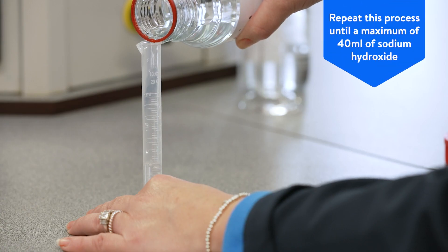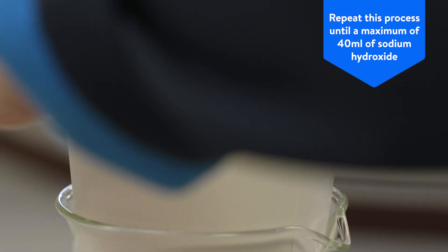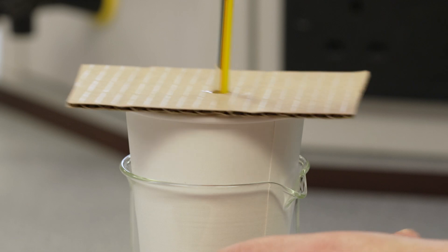Repeat this process until a maximum of 40 milliliters has been added to the beaker. Students should then wash all the equipment and repeat the experiment.